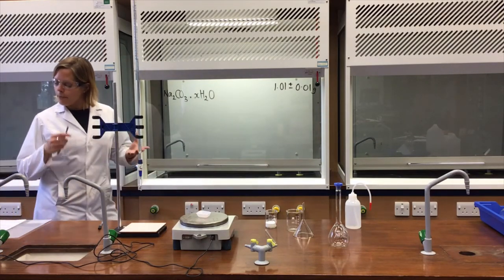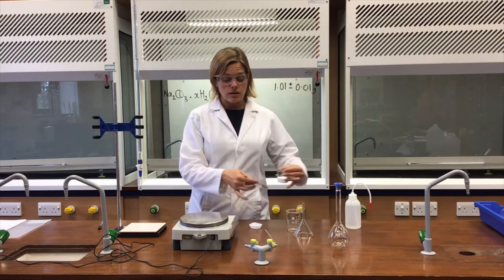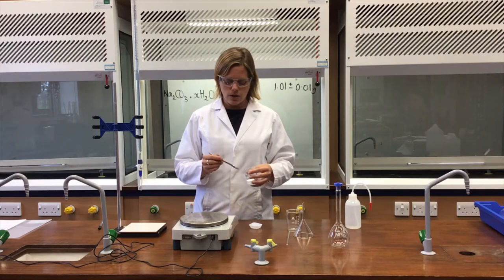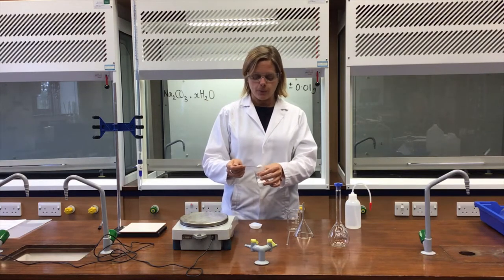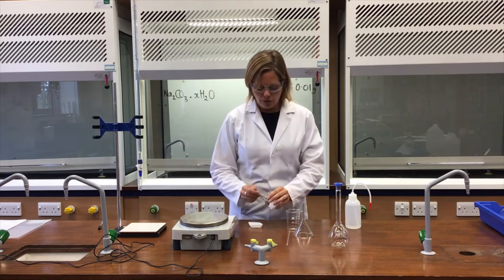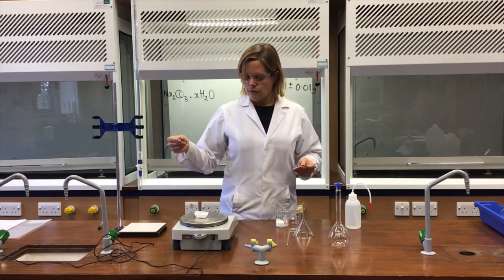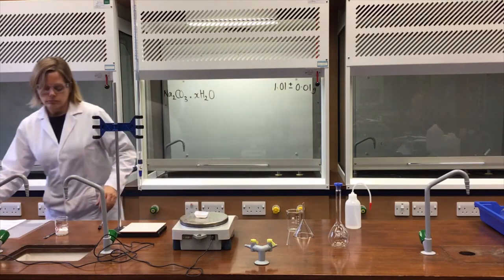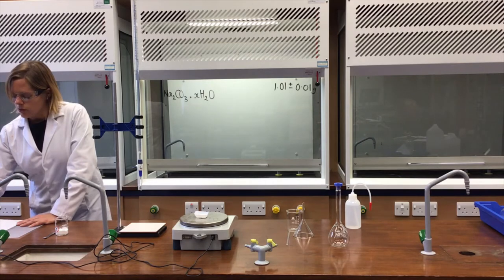The method says approximately 3.5 grams of solid, so I take the weighing boat off the balance — carefully, so that if I spill any washing soda it lands on the bench rather than on the balance top, which would invalidate the measurements. About 3.5g plus the 1.01g boat should give a total of about 4.5g. I add one spatula at a time; after several additions the balance reads 4.55 grams — close enough. Mass of weighing boat plus solid: 4.55 ± 0.01 grams.